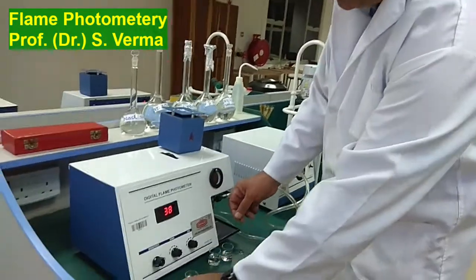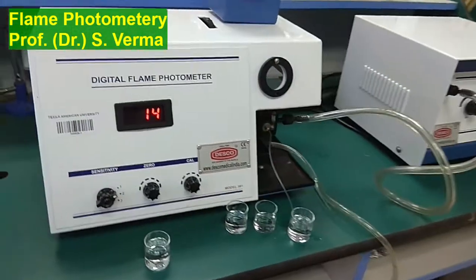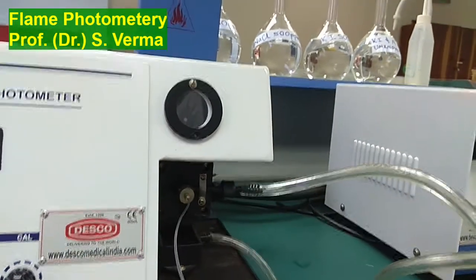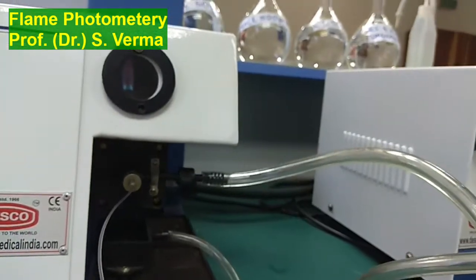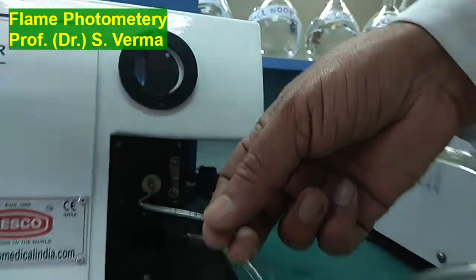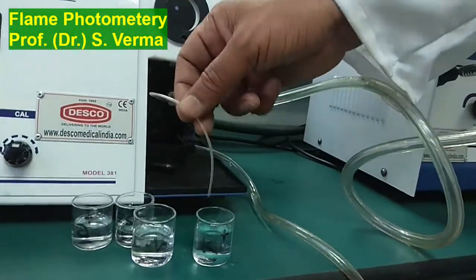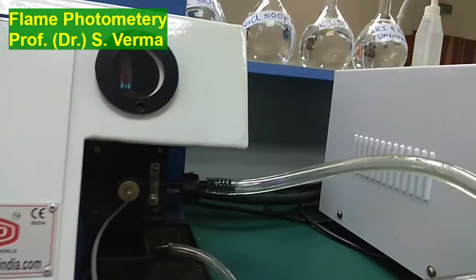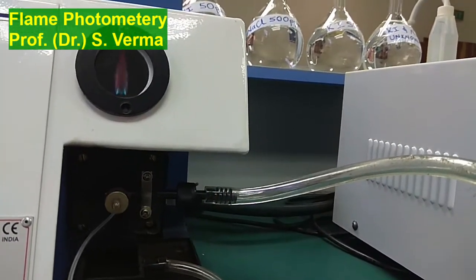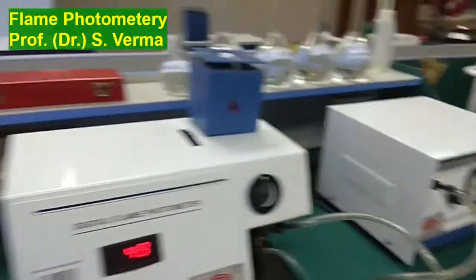And just to show you the potassium color, I am putting it back in distilled water, and then in potassium, because we missed at that time. So right now with the distilled water, the color of the flame should come blue, nice blue color, and then on putting in the potassium solution, it should show a purple color. Violet color. So that is an indicator that potassium is there. Although we are not really concerned with the color here, we have already found out our results.